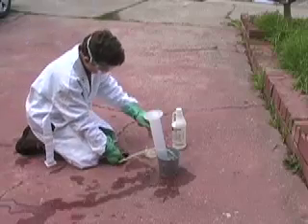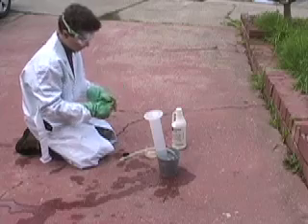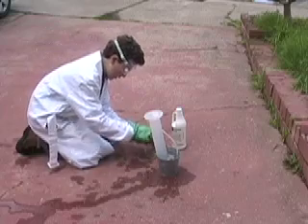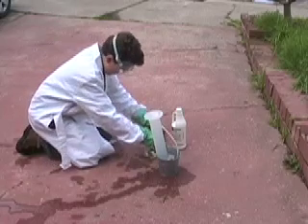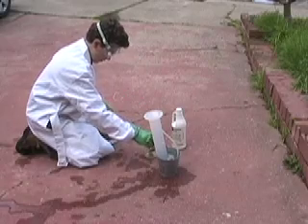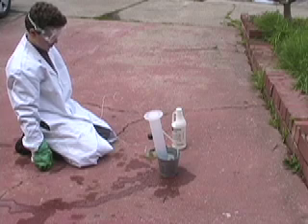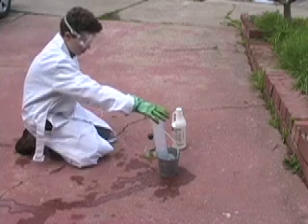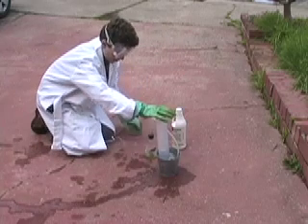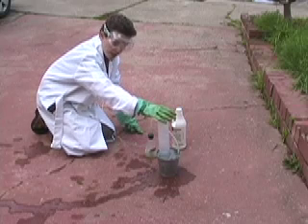I'm going to put in the magnesium, and as you can see — maybe you can see on the camera — it's very, very corroded, so it'll take a while for the reaction to really get going. You can start to see a few bubbles coming up, and now more and more. The gas is going to displace the water in the bubble trough, so you're going to start seeing water coming out of the bucket.